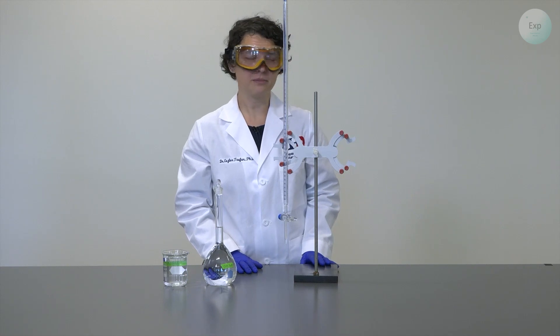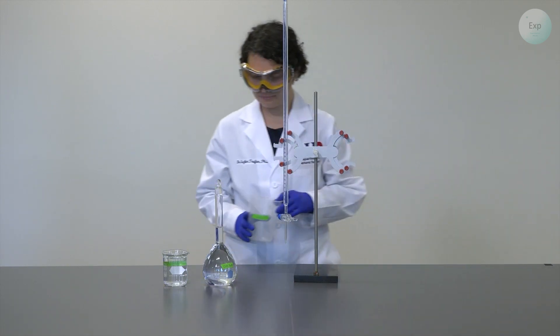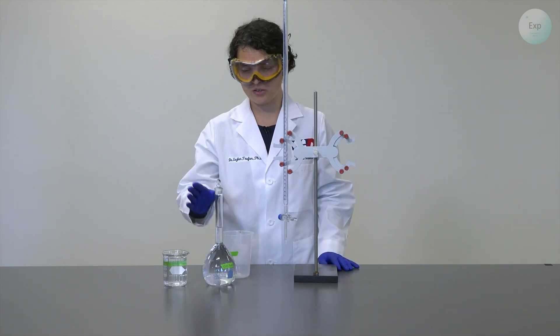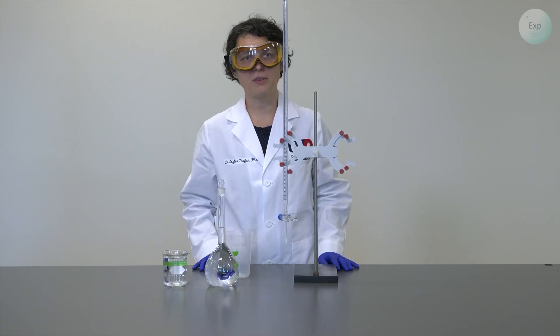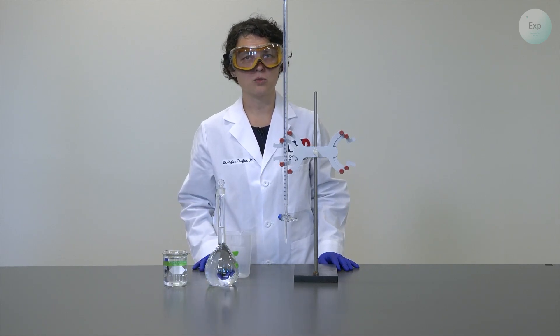we also need a waste container and a secondary container so that we're not using the large 500 milliliter volumetric flask to pour the charging solution from.